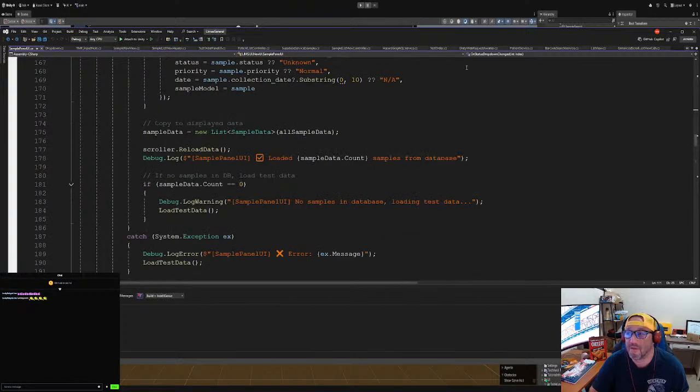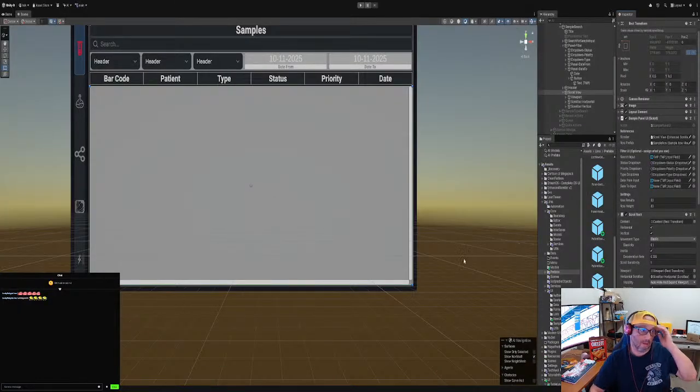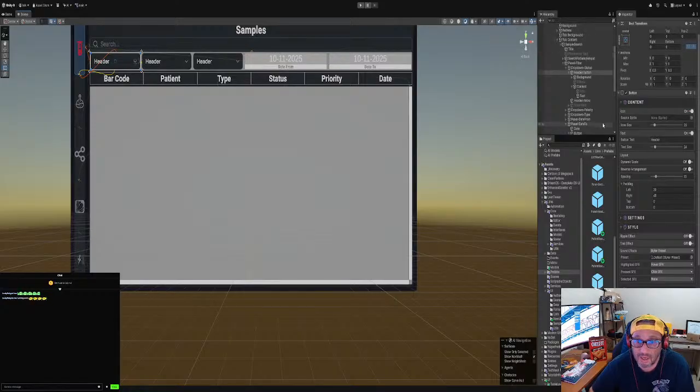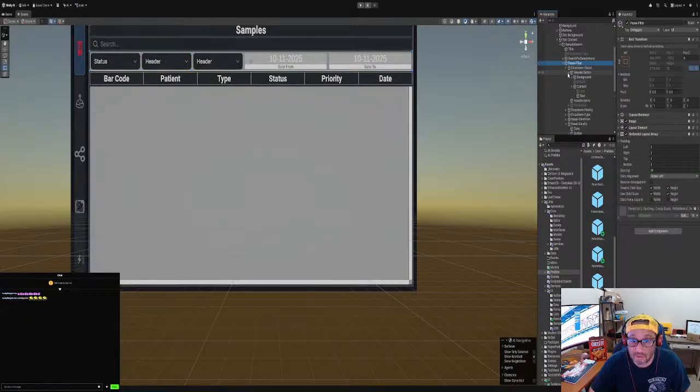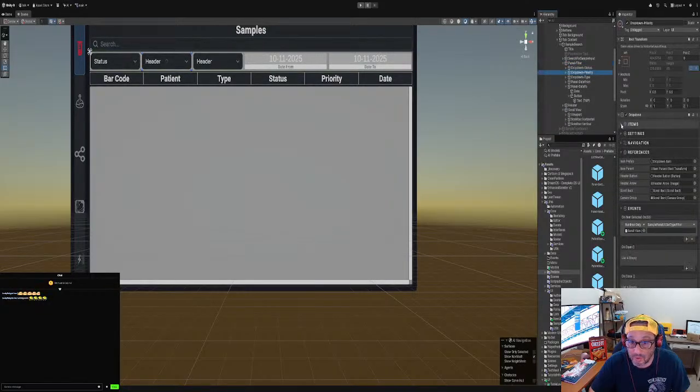Now let's go back to the UI. Here I set up the drop downs. You could name each drop down; I named each one to remind me what it is. Button text, we're going to say status, because this controls the status of the sample that we want. And then filter panel filter. Boom. This is going to be the priority.